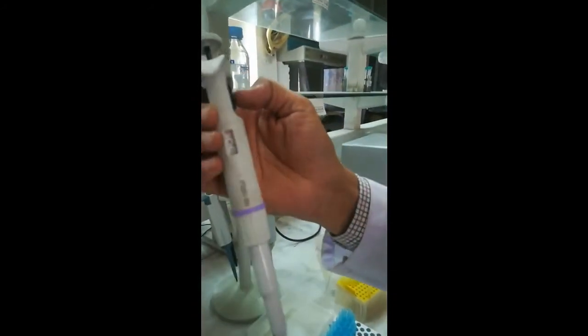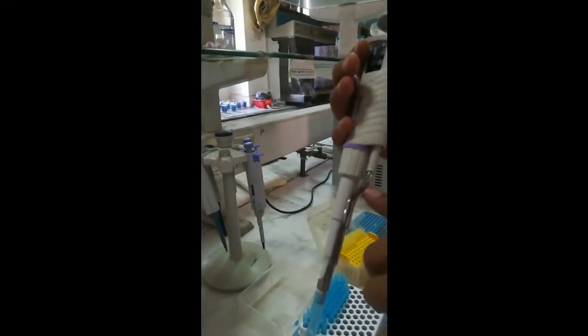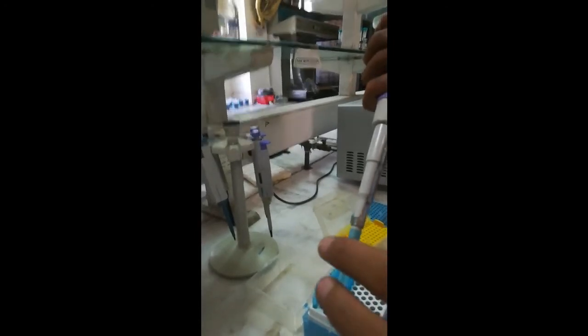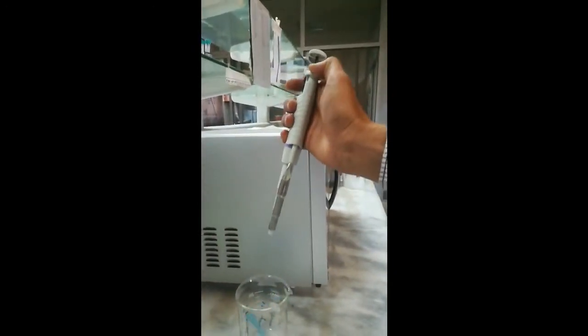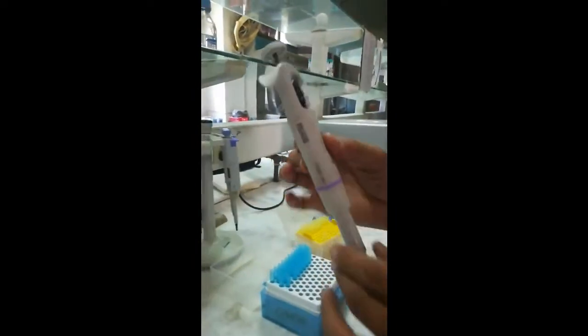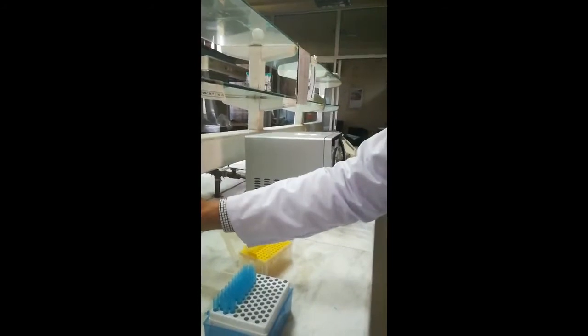There is another button on the micropipette used to remove the tip. We press it and the tip is ejected easily. Now we know the function of this pipette.